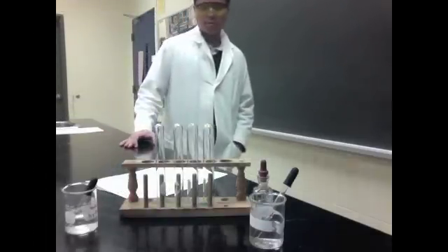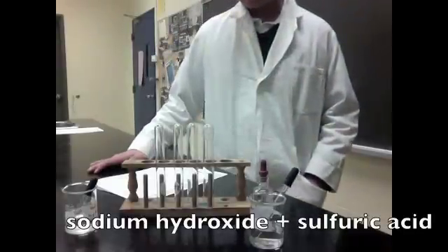Hi, my name is James and today we're going to be doing the sodium hydroxide and sulfuric acid experiment.